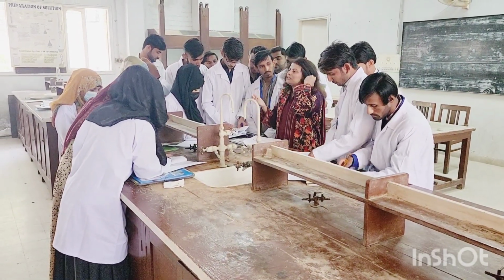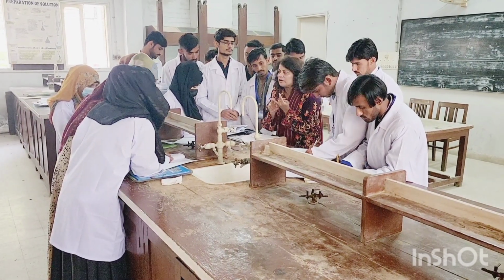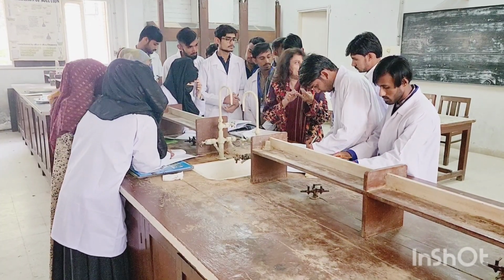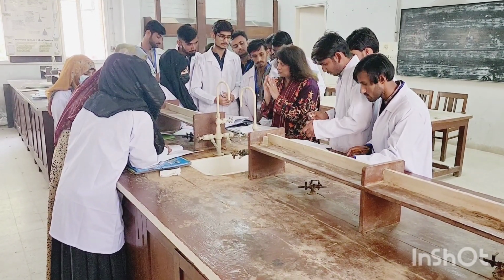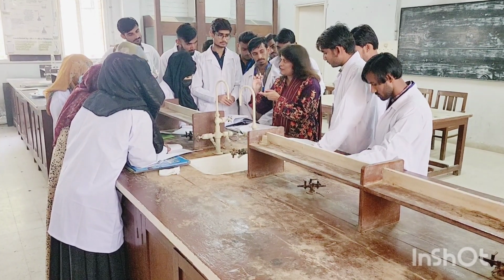Now, the solubility test tells you about the compound, whether your compound is soluble in water, if it is ethyl alcohol soluble, if it is soluble in any acid, if it is soluble in any base. So you are going to try a number of solvents. That is, first you will start with water. Take a small portion of water, that is 2 ml, in your test tube.